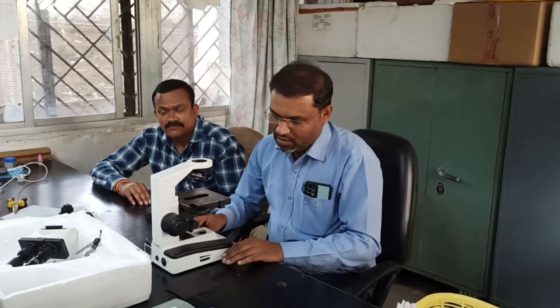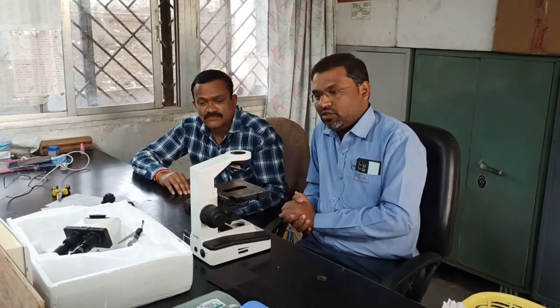We know that this microscope is a small device, but it is very, very important for pathology and microbiology. We can diagnose various types of microorganisms, right? Those are not easily visible to the naked eye. For that we are using a microscope.